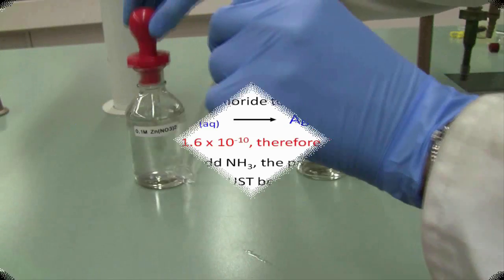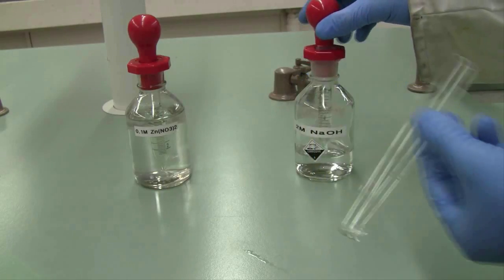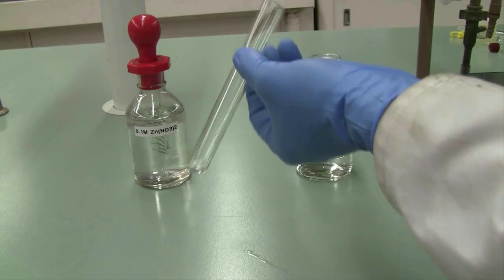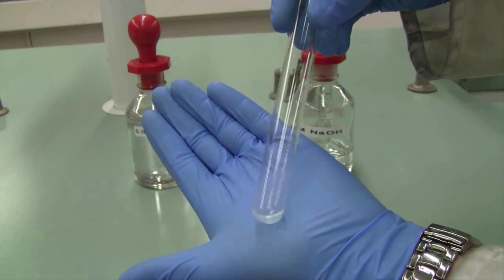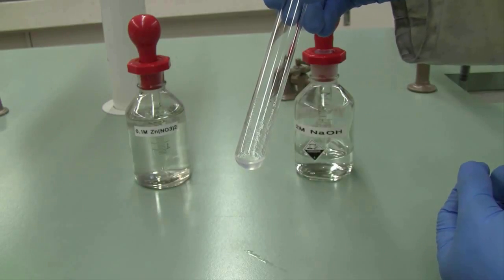Moving on to section C, we're now taking a variety of different metal nitrate solutions and then adding hydroxide to them. In this case, I've got zinc nitrate, and upon the addition of a drop of sodium hydroxide, you can see that we get a precipitate, an almost colorless, slightly cloudy gelatinous precipitate. To understand this reaction, we need to understand complex ions.